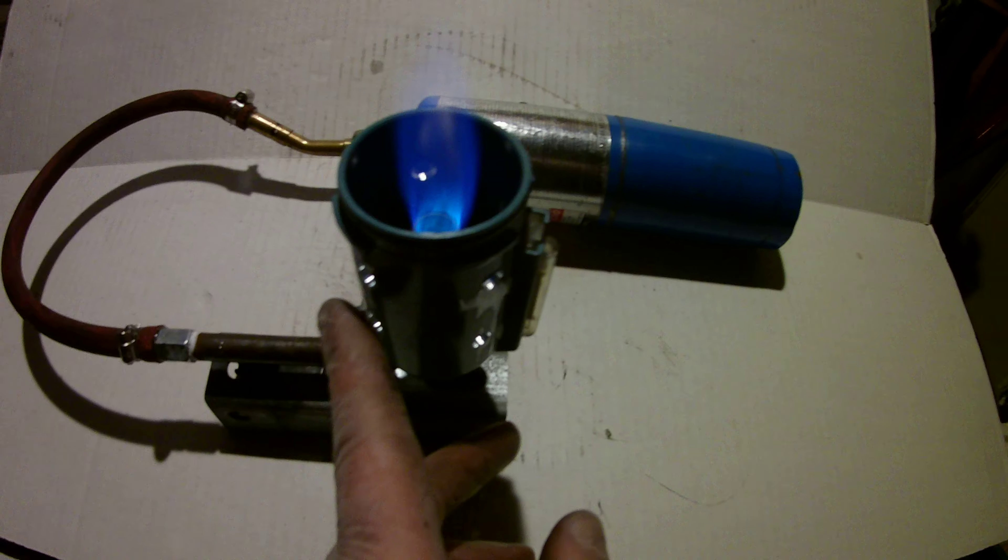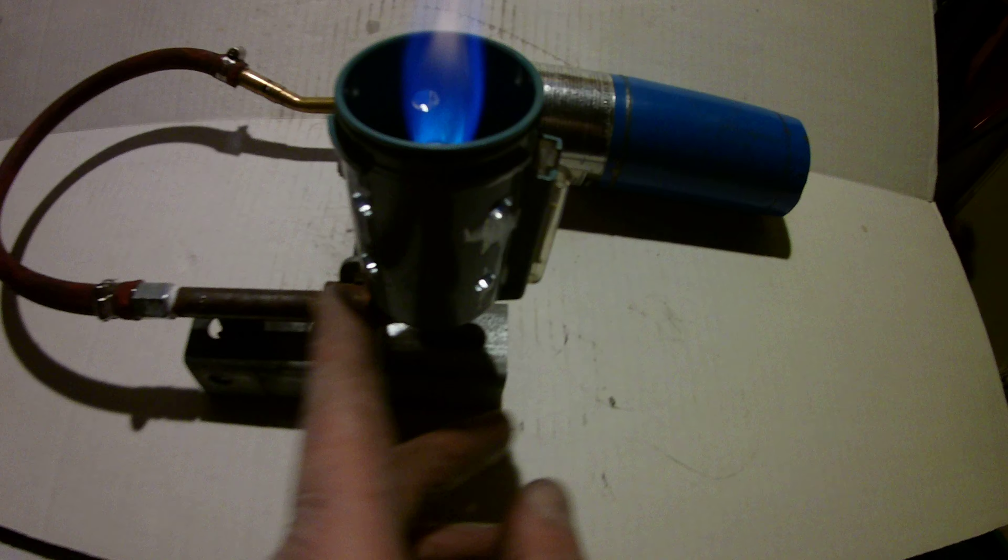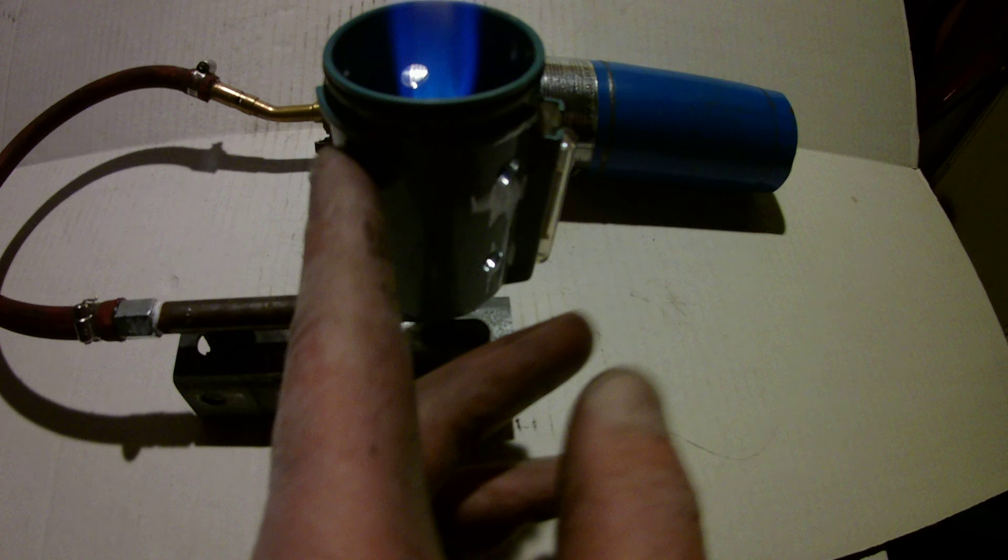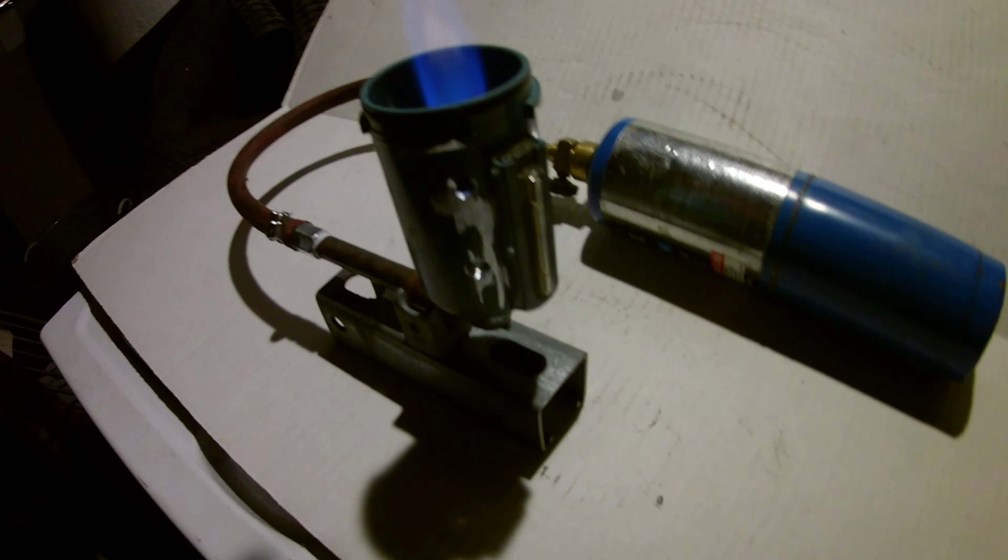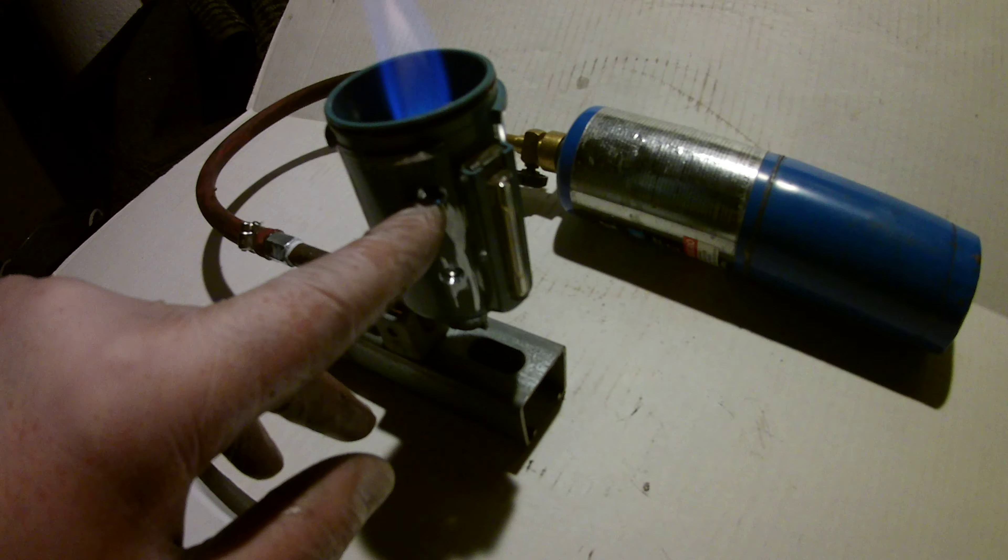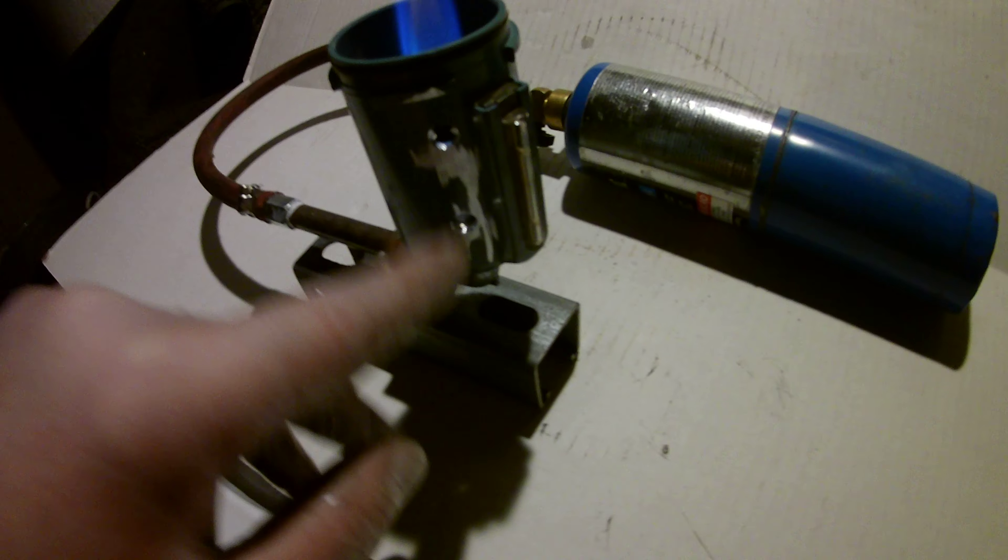And she was working really good for my gas torch housing. I've used an old industrial part that I've drilled holes in. That way, if I wanted to, I could put a vessel on top of this without extinguishing the gas jet, because I'll have air flow here.